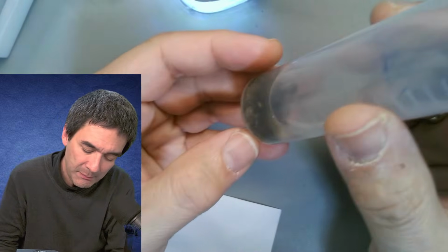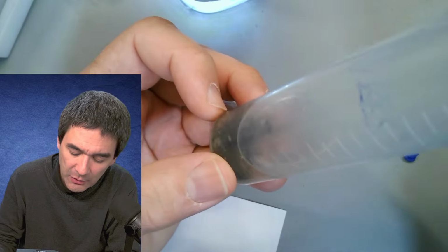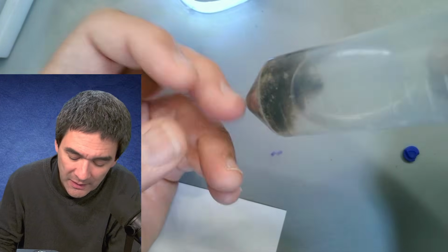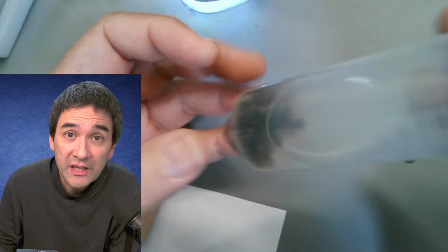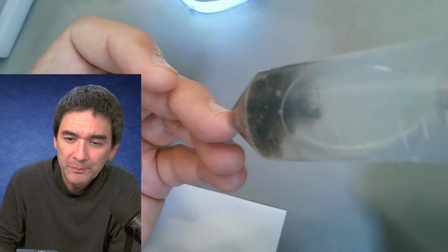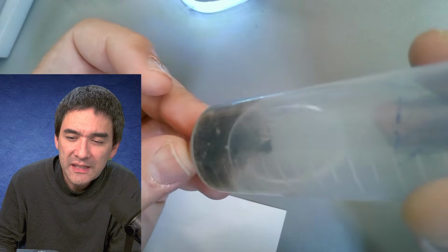And what's going to happen is if you put the hydrogen peroxide in here, and wait maybe a day or so, possibly even warm it up over a water bath, then all of the organic material is going to start to be oxidized away, and the diatom shells will start to collect on the bottom. Okay. So that is the diatoms and desmids.